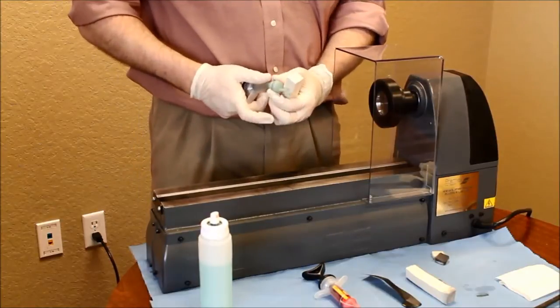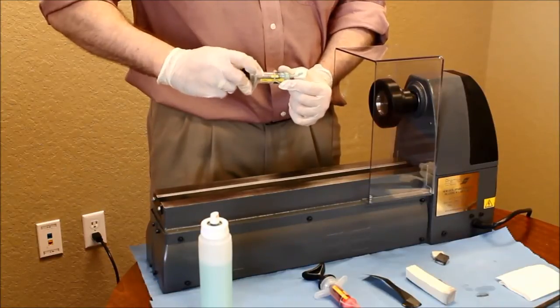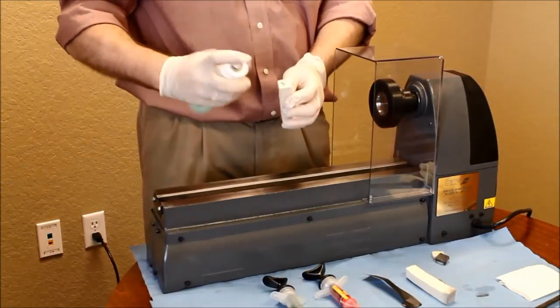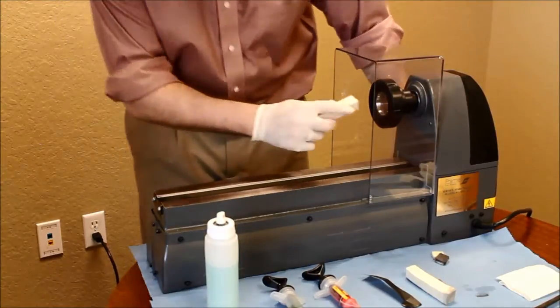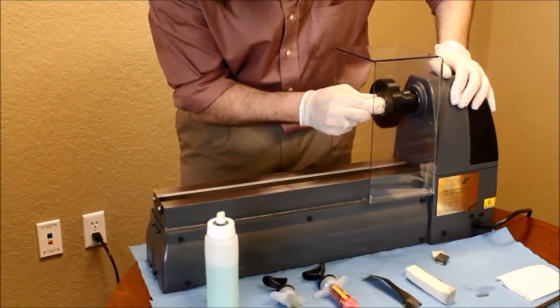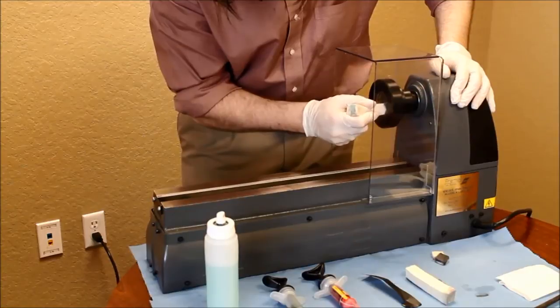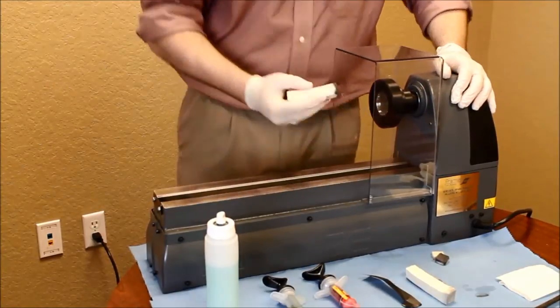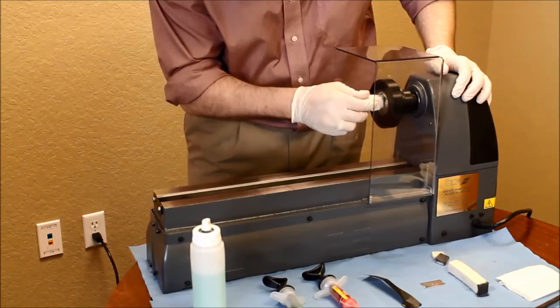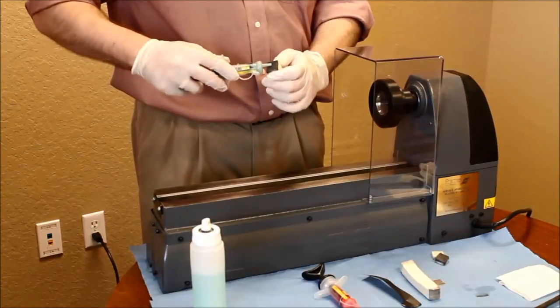Once the 8 micron diamond compound has been fully applied, transfer to the 3 micron diamond compound. Apply the 3 micron diamond compound to a hard grinding stick, coating with oil, and if necessary, stop the lathe to apply. Again, ensure to grind from the center outwards, keeping even pressure applied, and once complete, remove the polishing compound with a soft cleaning stick. If necessary, repeat the process of applying more 3 micron diamond compound until a mirror image can be seen.